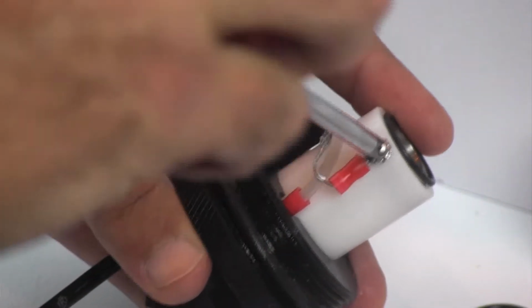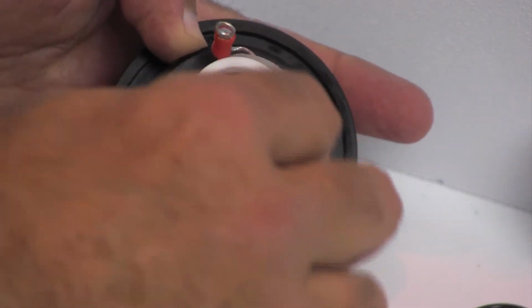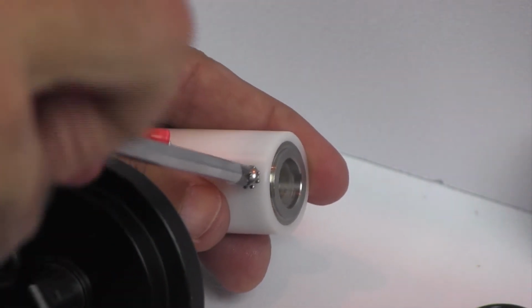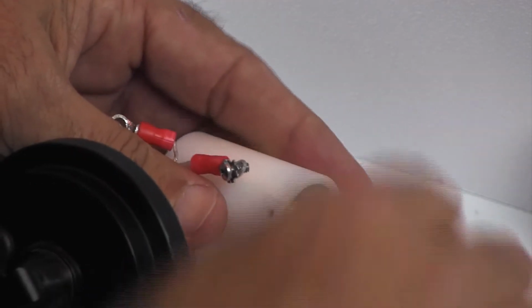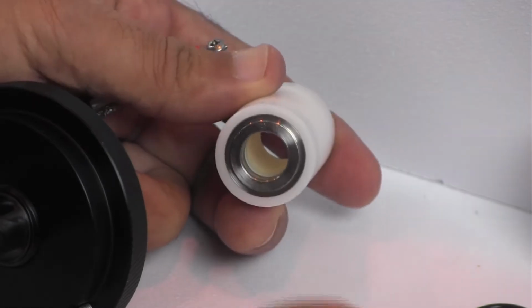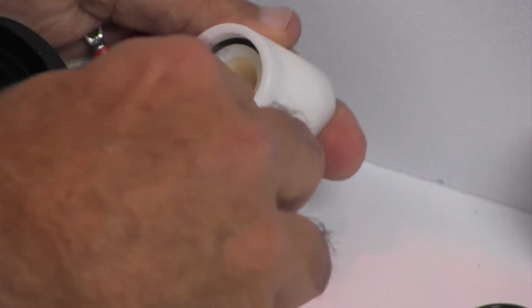Carefully remove the screws securing the electrodes to the probe sleeve. Take out the electrode, along with the outer and inner O-ring seals. Repeat the process for the electrode on the opposite end of the sleeve. Set aside the two electrodes for installation in the new sleeve and discard the used O-rings.